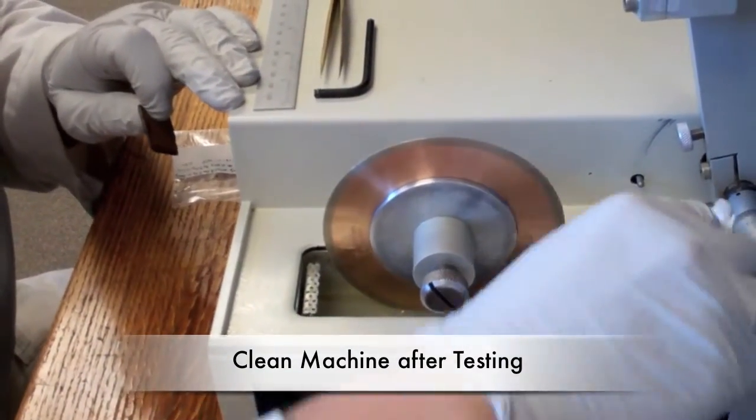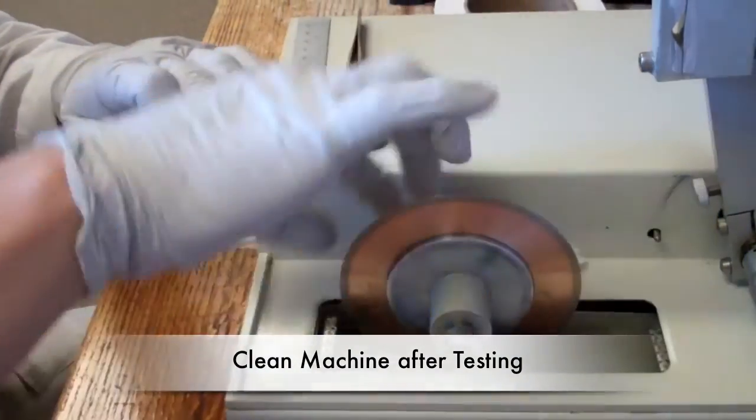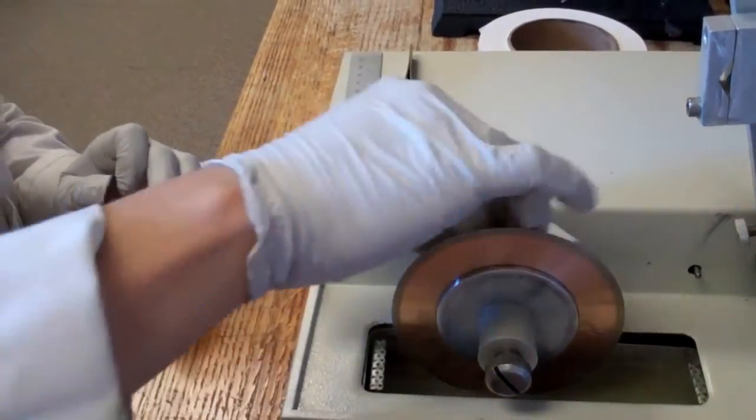After you are done using the machine, it must be cleaned as oil may have splattered during the cutting. This keeps the instrument in good condition and leaves it ready for the next user.